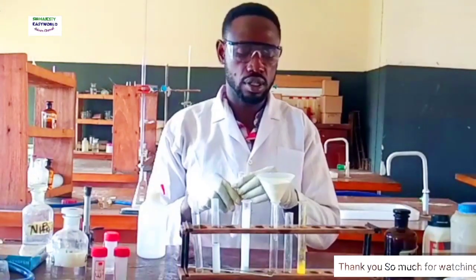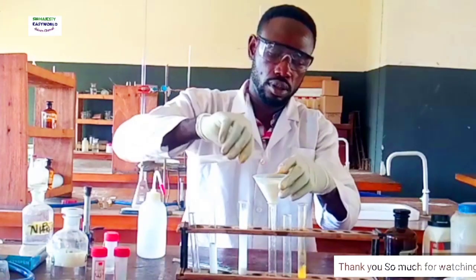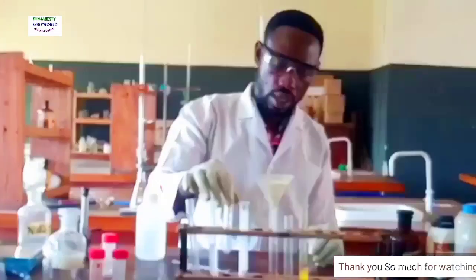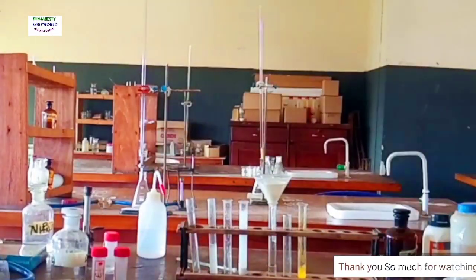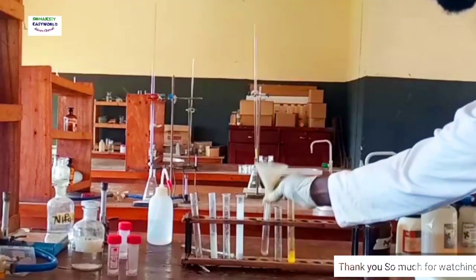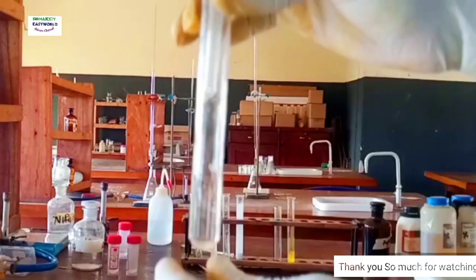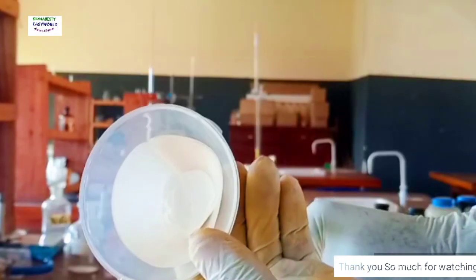You can see the filtrate is clear, and then white residue. Okay, see, the filtration is complete. So here is the colorless filtrate, and here is the white residue.